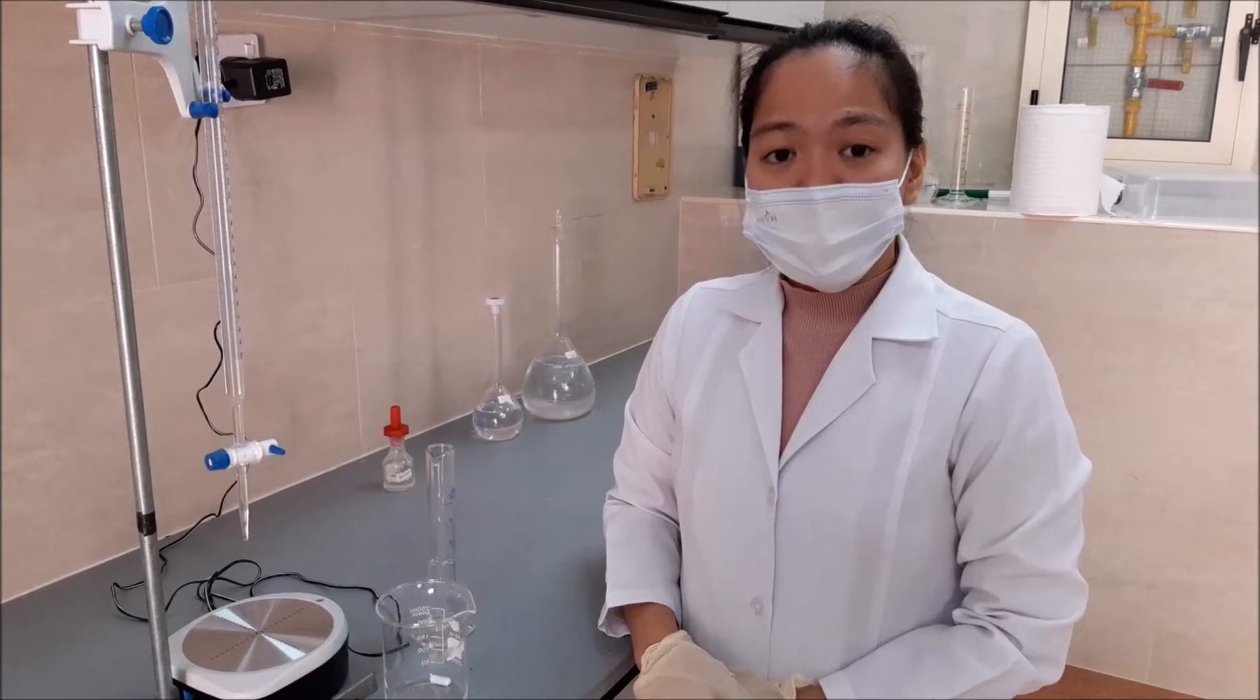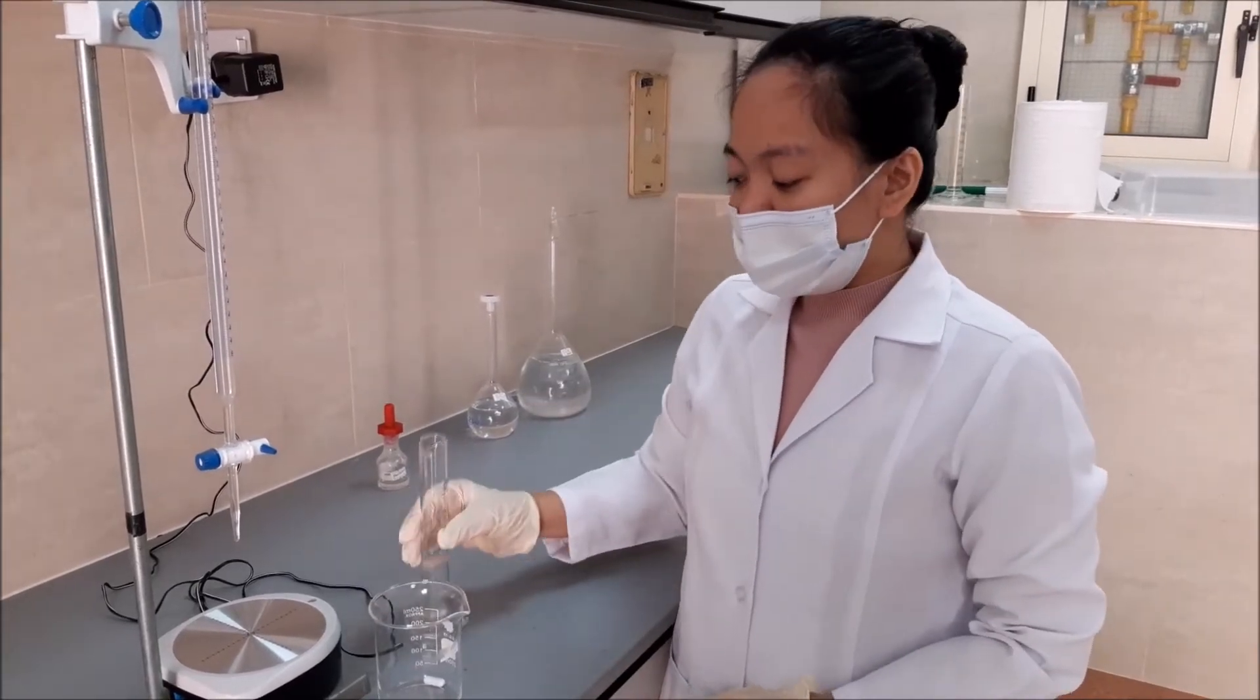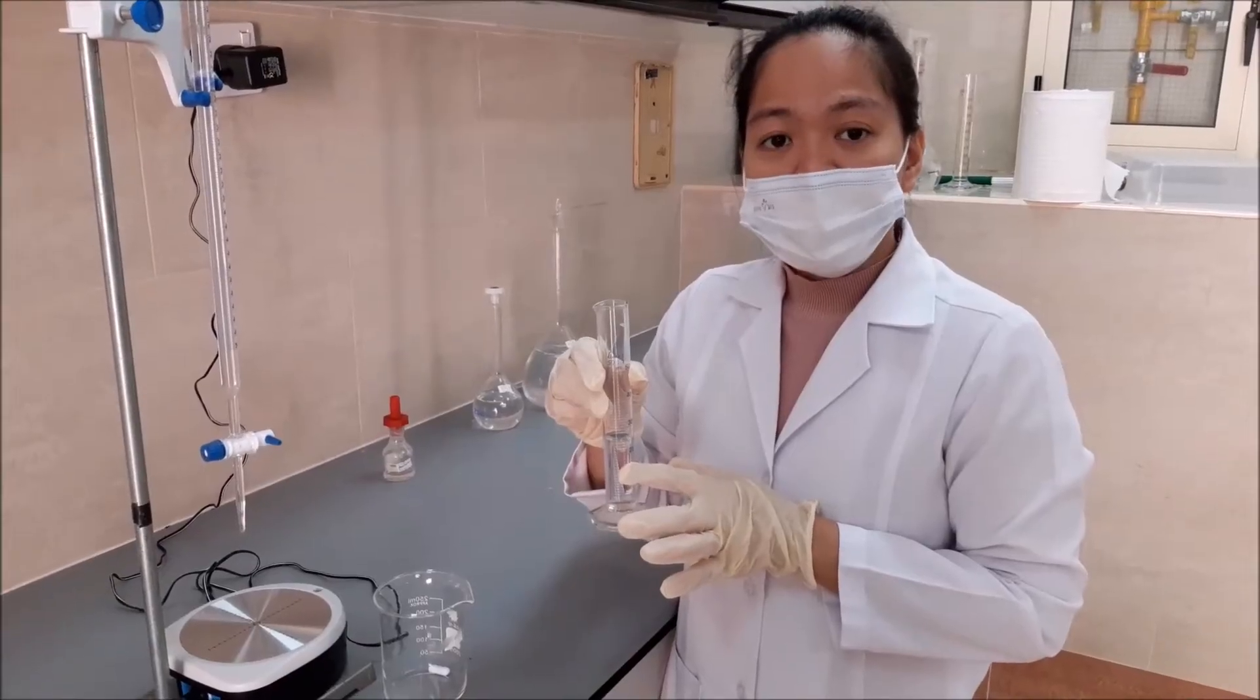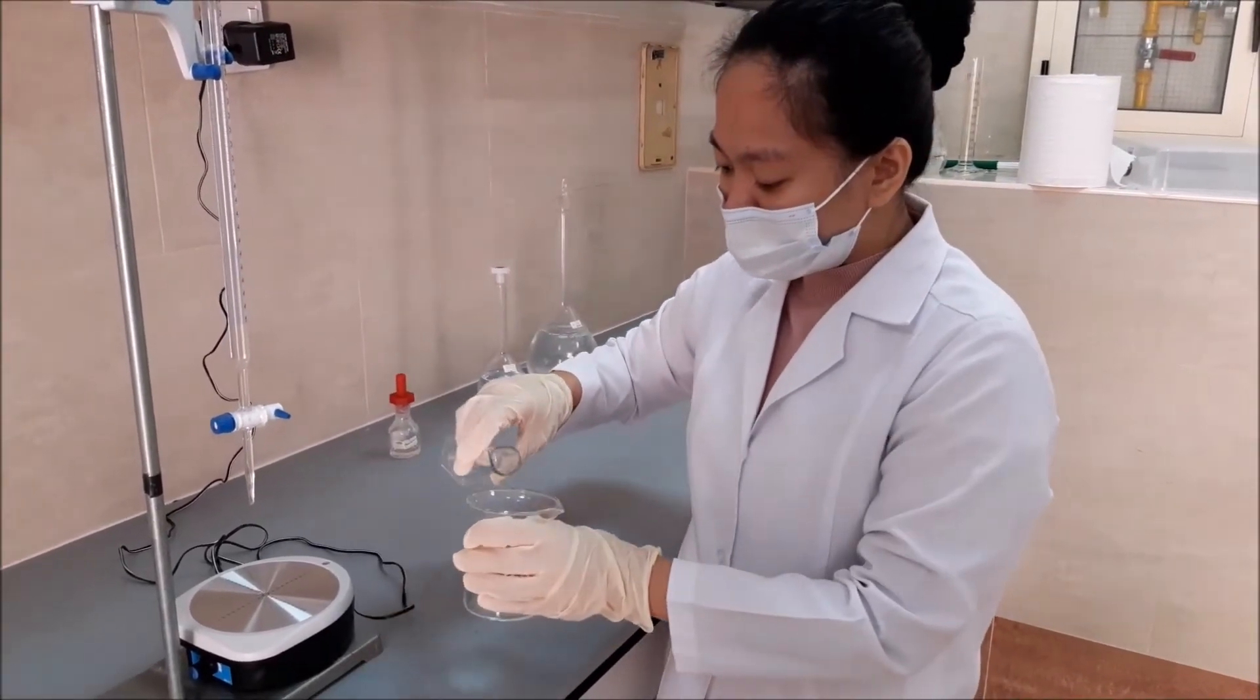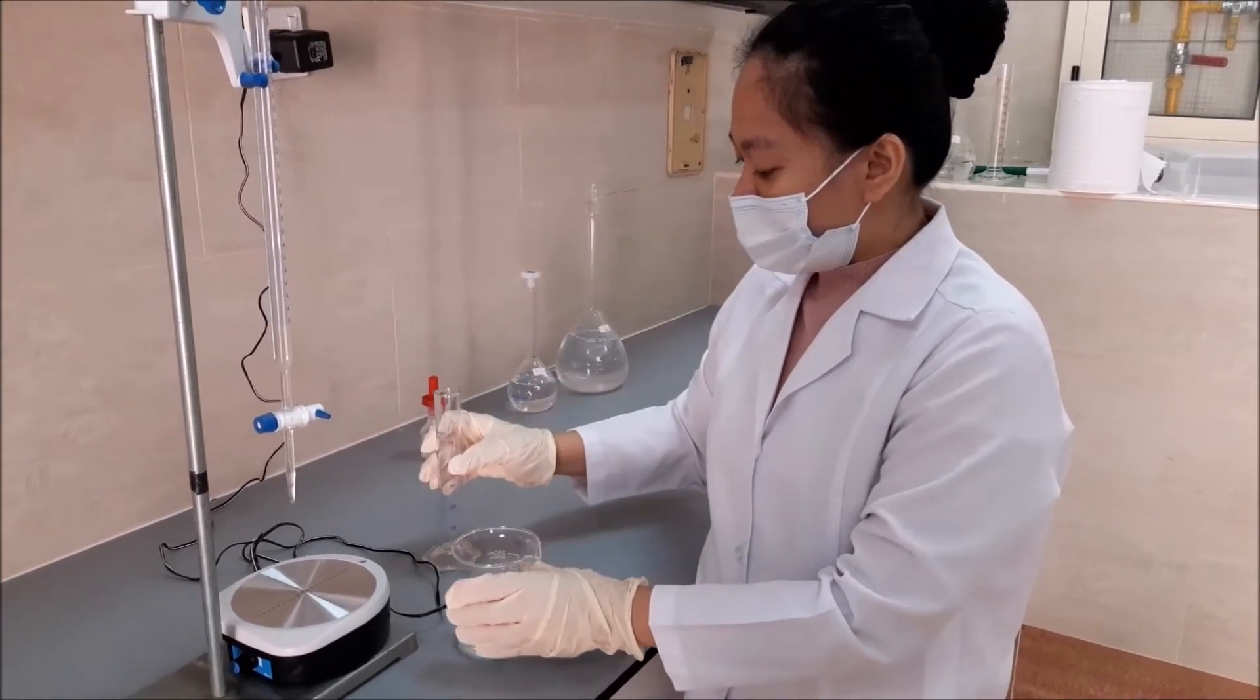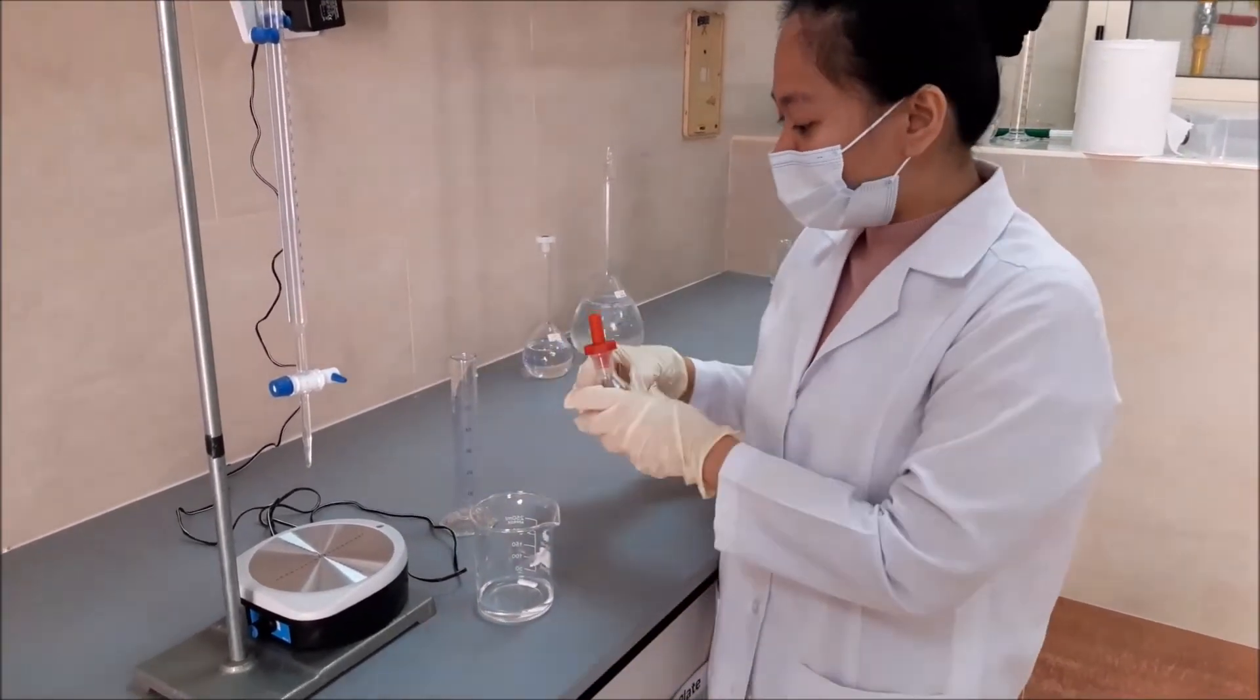So this is our trial 2. I will pour again the same amount of sodium hydroxide, 0.6 molar, in our beaker and put 3 drops of phenolphthalein.